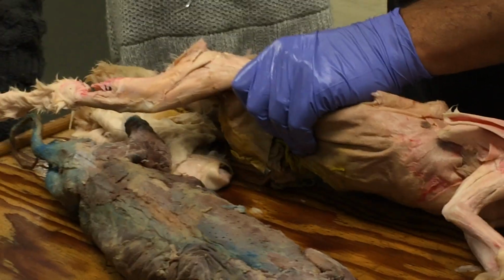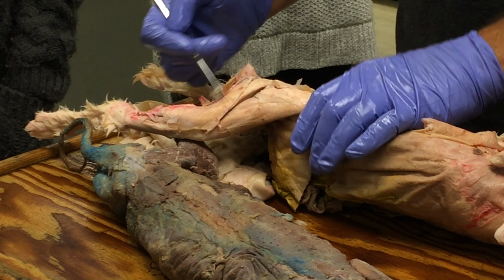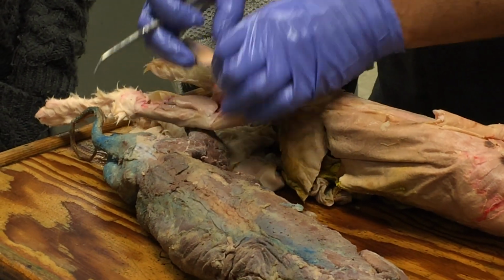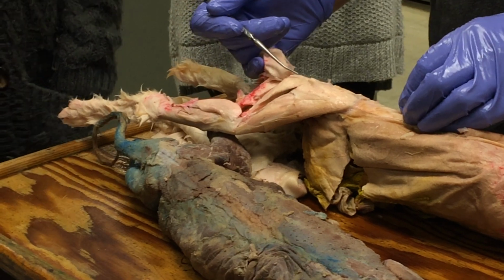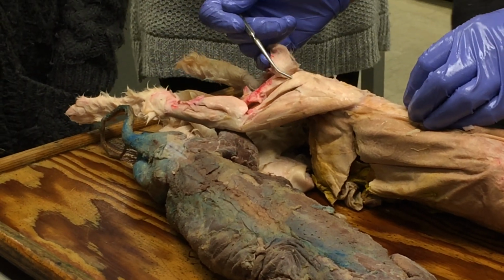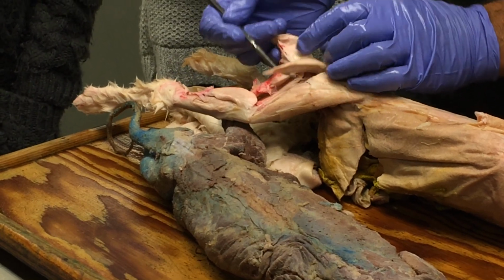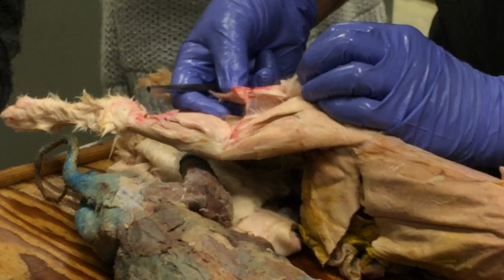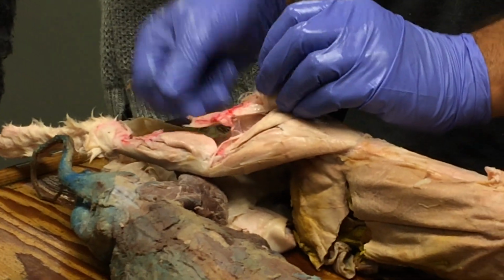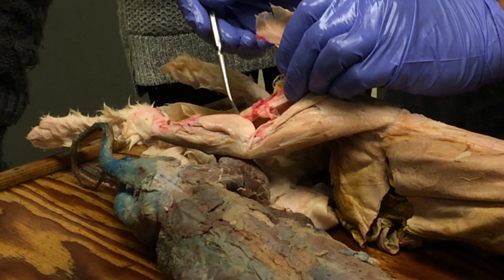So then on this guy here again is biceps femoris on the rabbit. Pull that back. This is the cauda femoralis of the rabbit, and it's much bigger in the rabbit than it is in the cat. And then this muscle here better be semitendinosus on the rabbit, and it got cut off, but it lay just like that.